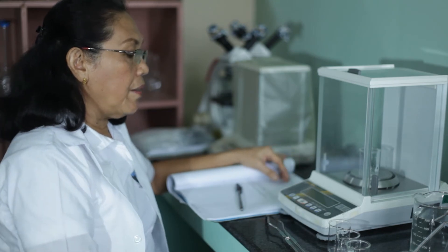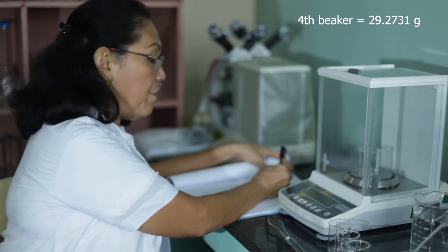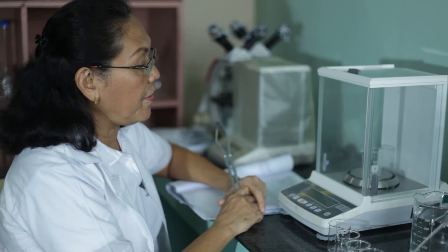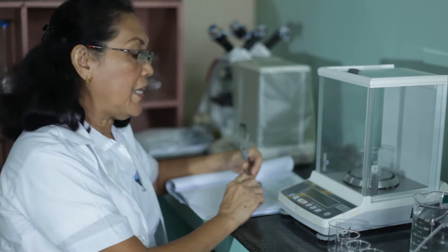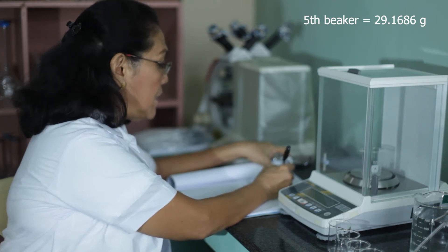Then let's weigh beaker number four. Beaker number four weighs 29.2731 grams. Then the fifth beaker weighs 29.1686 grams.